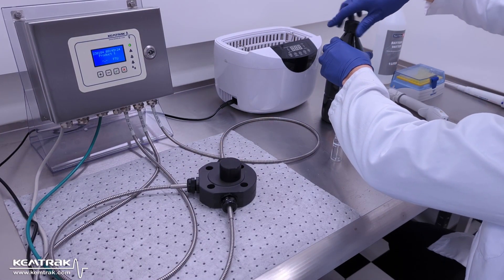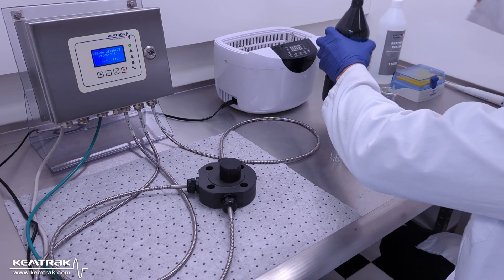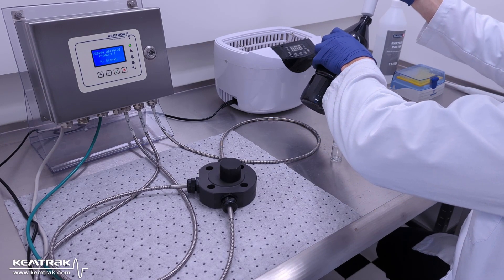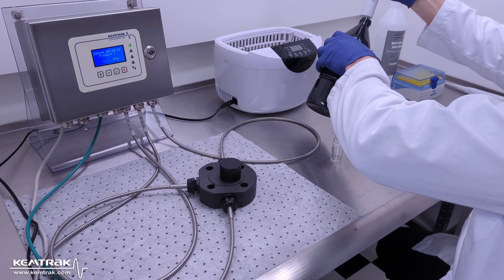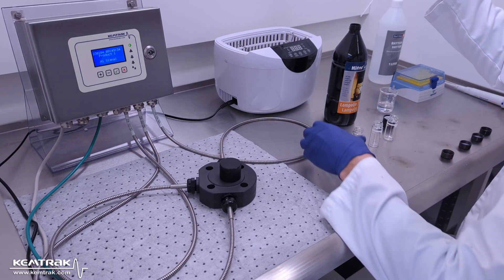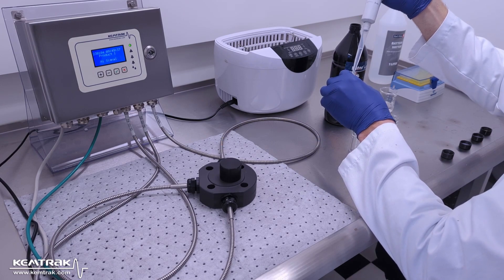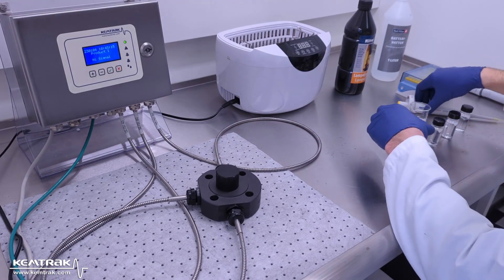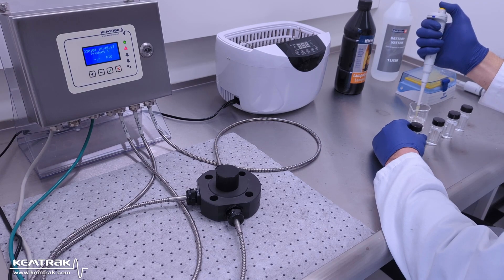Firstly, I prepare four samples with 15 mL kerosene in each vial. I put the water in the sample using a micropipette.